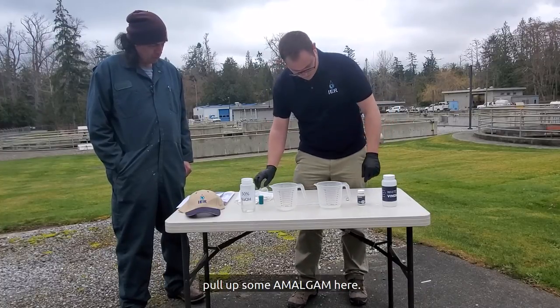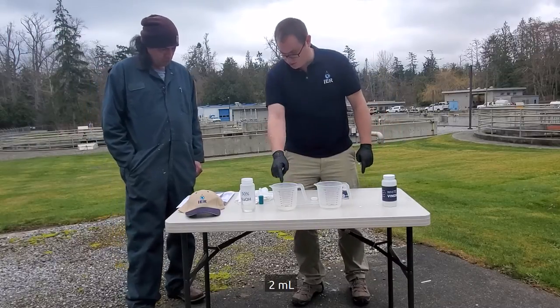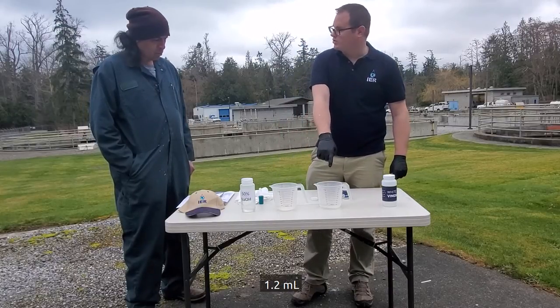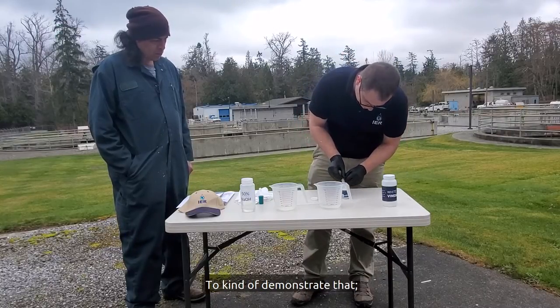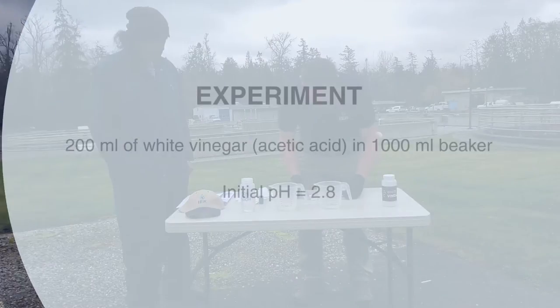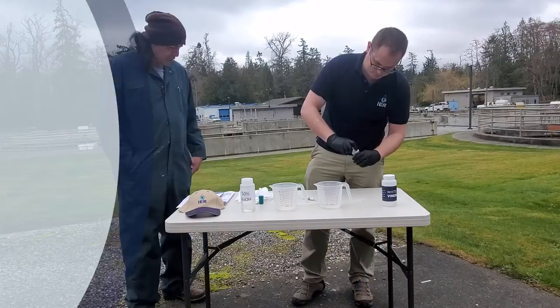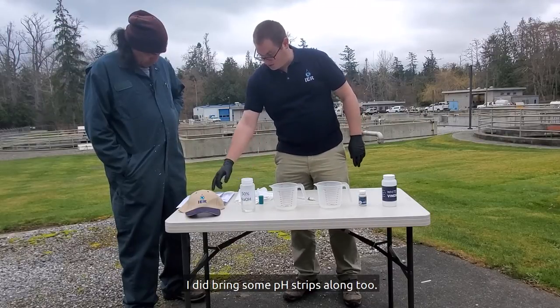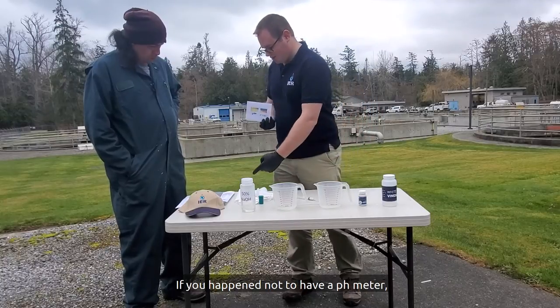What we're going to do is pull up some amalgam here. We're going to put 2 mils of the caustic in and then 1.2 mils of Amalgam 60 to demonstrate that usage rate difference. This is a little handheld pH meter. I also brought some pH strips — if you don't have a pH meter, you can use pH strips.